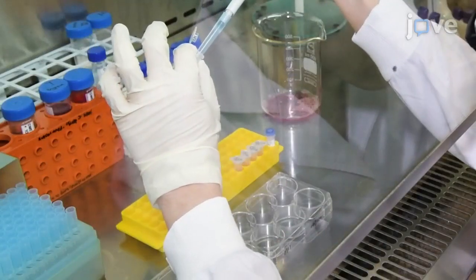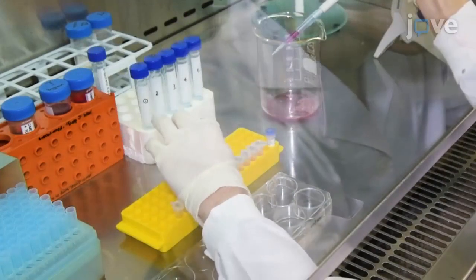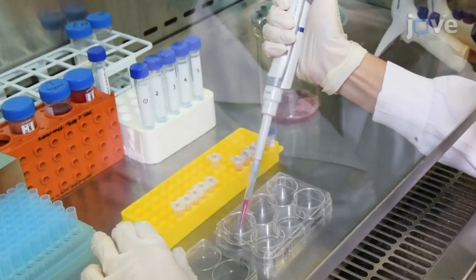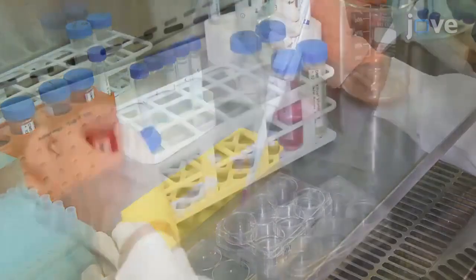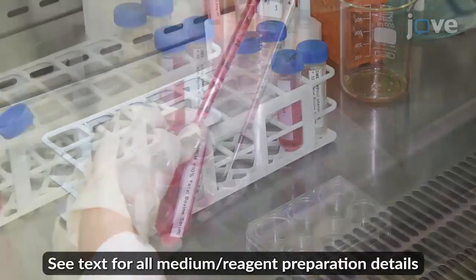Transfect 80 to 90% confluent 293T cell cultures with the vectors encoding the flag-tagged RAF kinases or their mutants according to standard protocols. After 24 hours of culture, replace the medium in each culture.